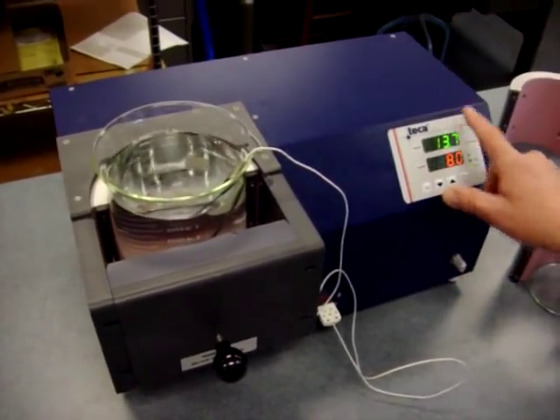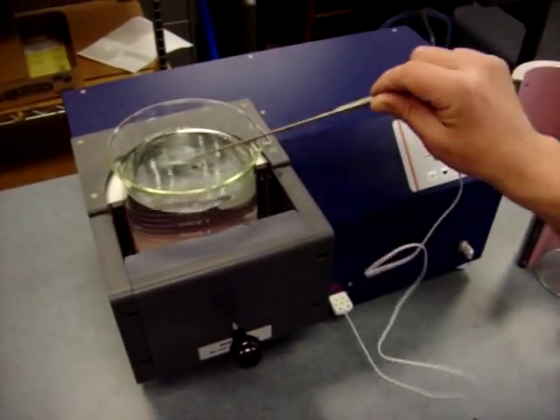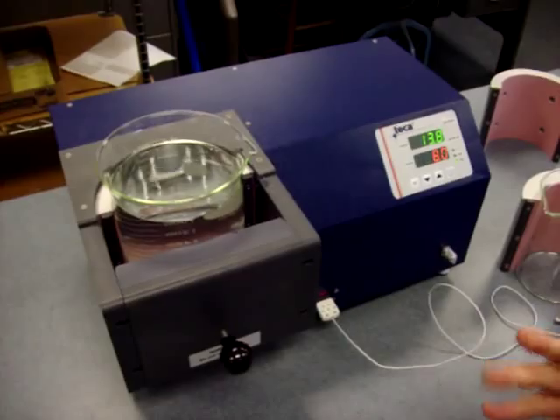We have a temperature controller here. It's set up using the remote temperature sensor feature. We're going to swap out this bottle for another bottle of a larger size.